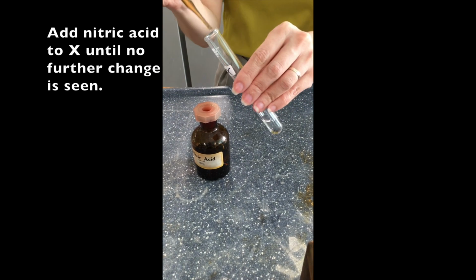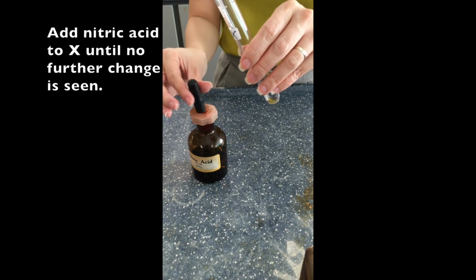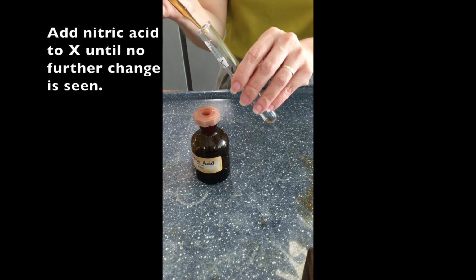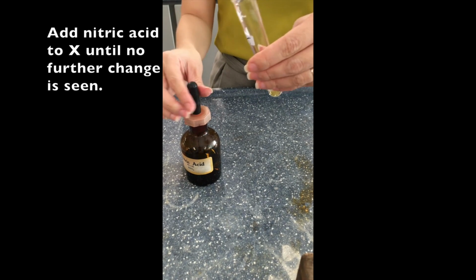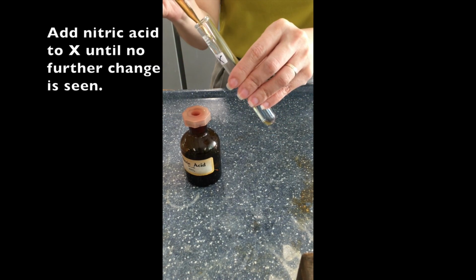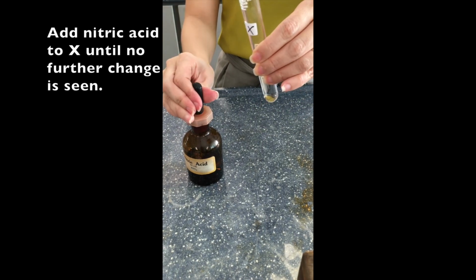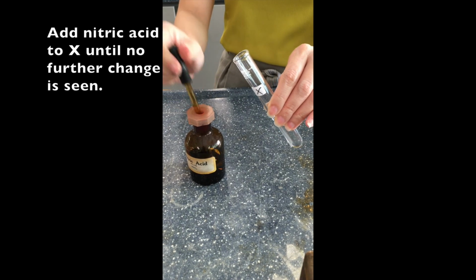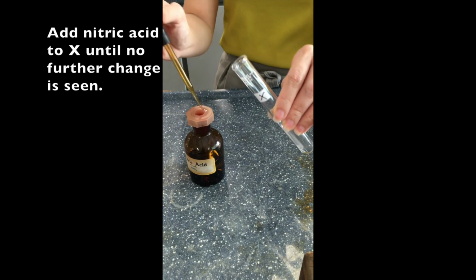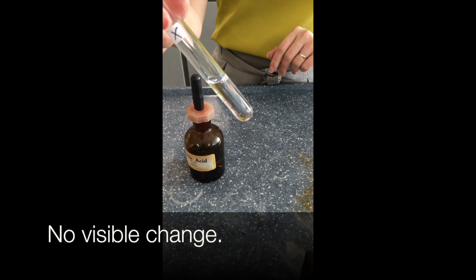Therefore, we will add nitric acid until about 1/3 of the test tube. So you can see that there is no visible change for X.